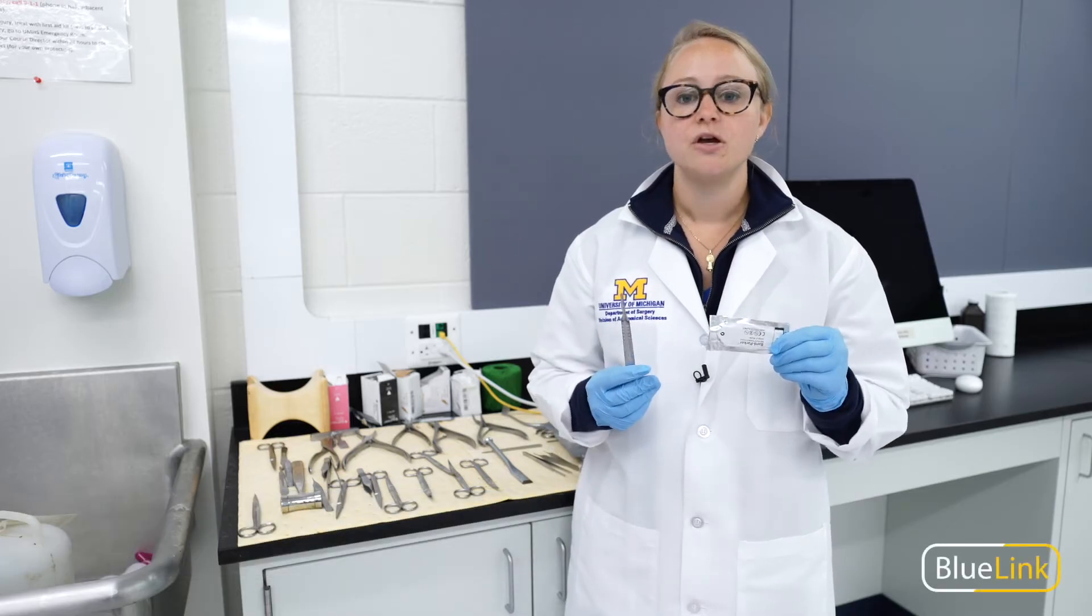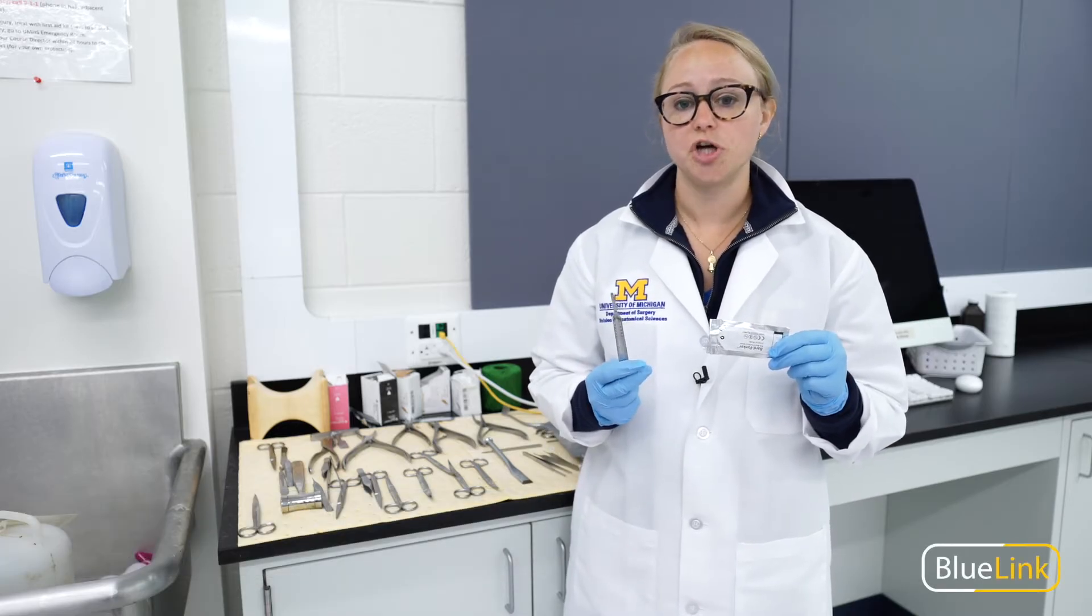Hi everyone, I'm Christina Prahl and in this video I'm going to show you how to safely load and remove a scalpel blade, which is an important tool used for sharp dissection in lab.